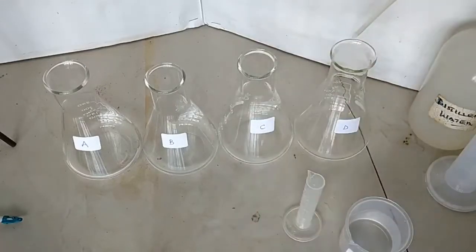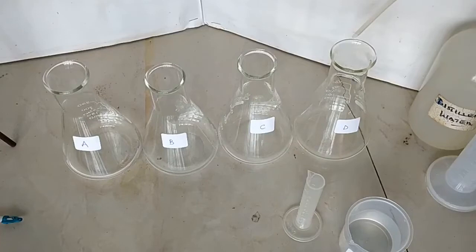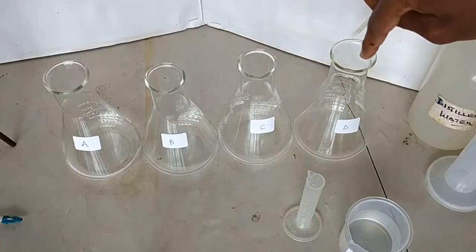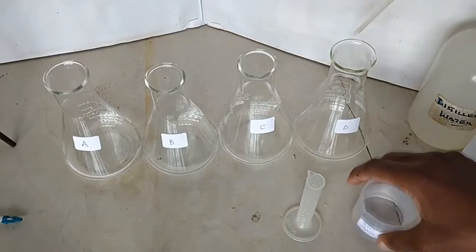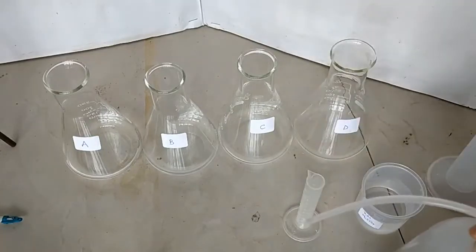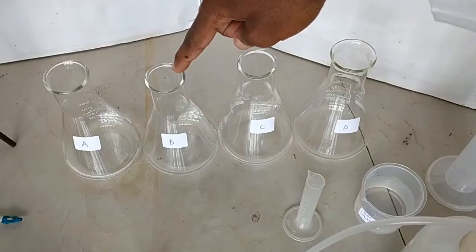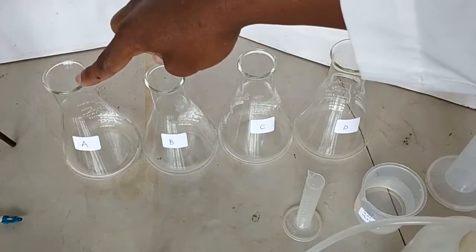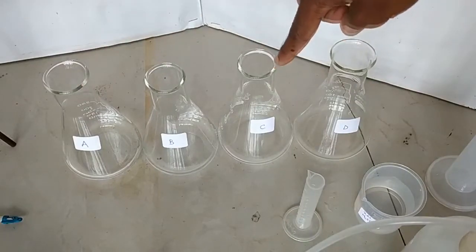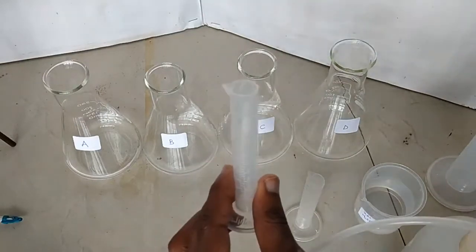The next thing is to dilute — because we're looking at how concentration affects the rate of reaction, I'm going to dilute the acid in flasks B, C, and D by adding distilled water. In flask B I'll add 10 cubic centimeters, making a total of 40. In flask C I'll add 20, and in flask D I'll add 30 cubic centimeters.